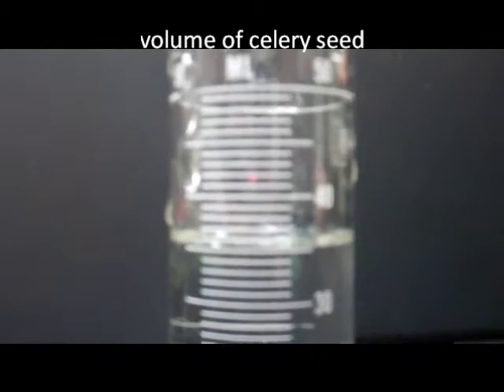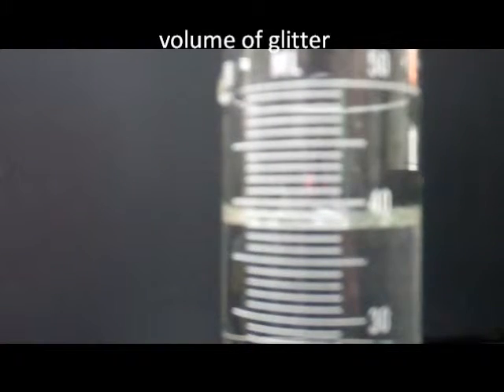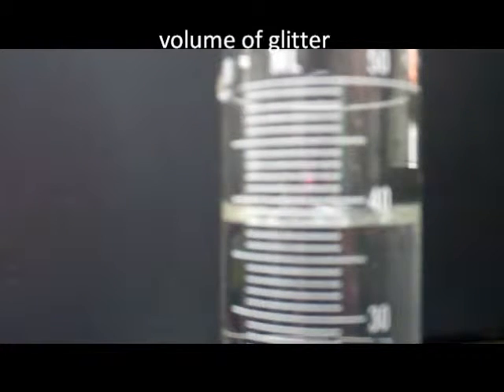Now I'm going to use the water displacement method to determine the volume of 1 teaspoon of glitter versus 1 teaspoon of celery seed. For the celery seed, I'm starting at 36 milliliters. Now the volume is at 39 milliliters. For the glitter, I'm going to start with 38 milliliters of water. Now the volume of the glitter is at 40.5 milliliters.